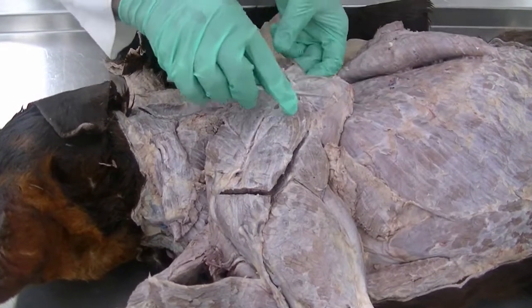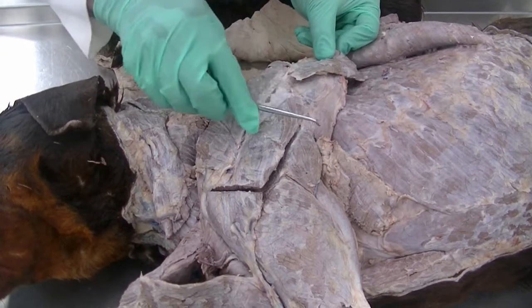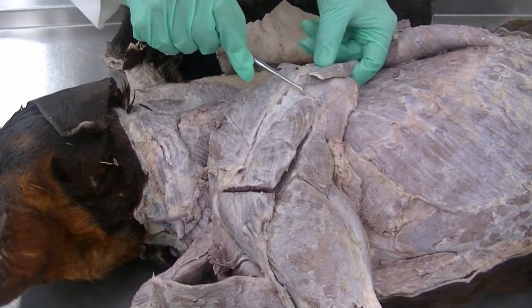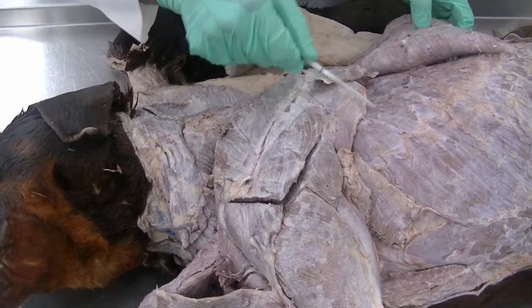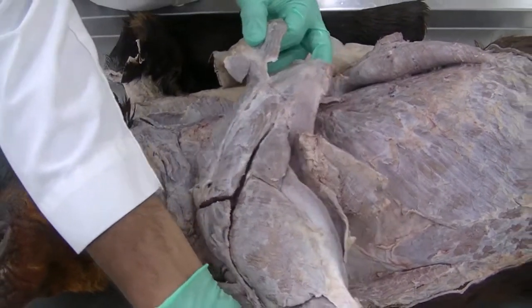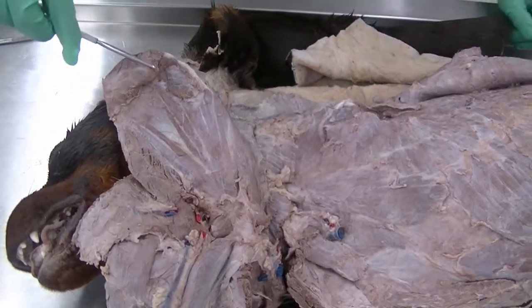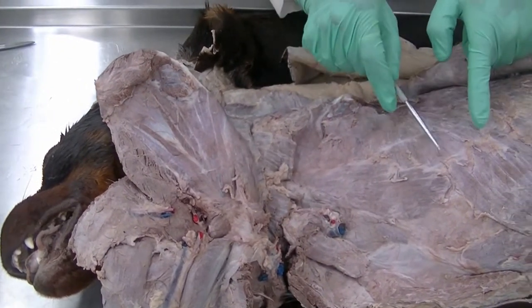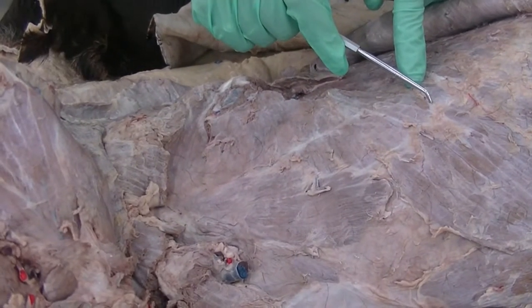In this view, we are trying to remove the forelimb, and then we'll see the relation between the serratus ventralis and the attachment of the serratus ventralis on the scapula from its medial side. As all the extrinsic muscles have already been transected, it's now quite easy. We can just flip the forelimb, and we can see the medial view of the shoulder region, which is formed by the scapula. Here we see the thoracic wall, and that is the extent of the serratus ventralis.